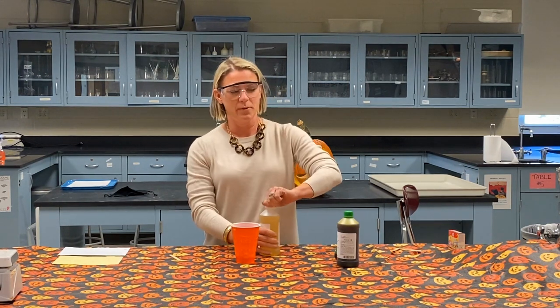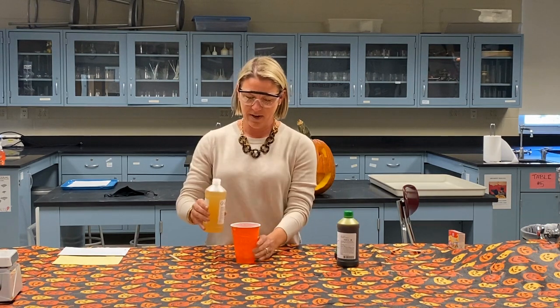So I'm going to show you a polymerization reaction. This would be something that you're familiar with, like styrofoam, or if you've ever had to spray that kind of foamy insulation into cracks in your basement. And so first I'm going to pour a solution of monomers and dimers.